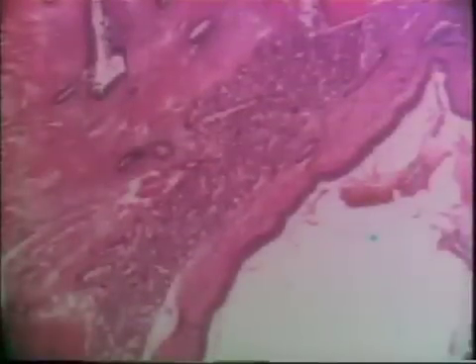This is a bronchus. There's cartilage on the right, mucous glands, smooth muscle, and respiratory epithelium. It's a smaller lumen. Also, the cartilage ring is not C-shaped but incomplete. As we go through here, we have segments of this cartilage tissue — it's not a complete ring or C-shaped ring of cartilage.